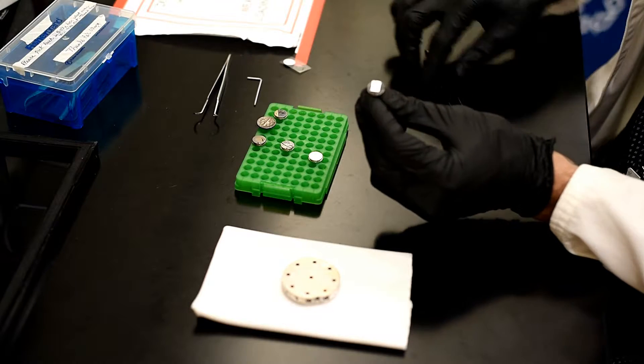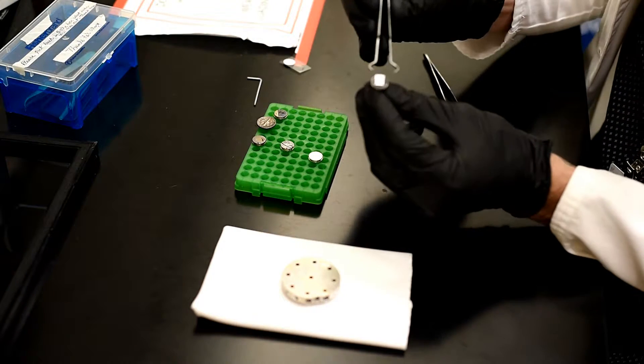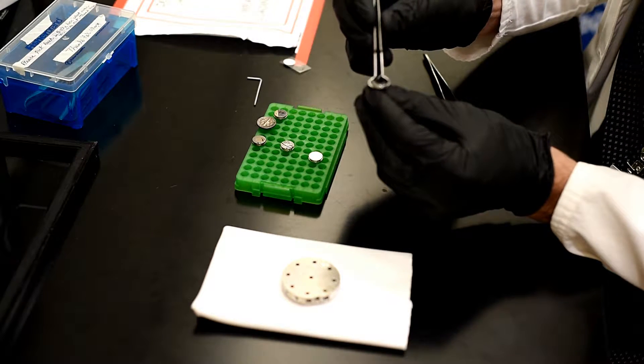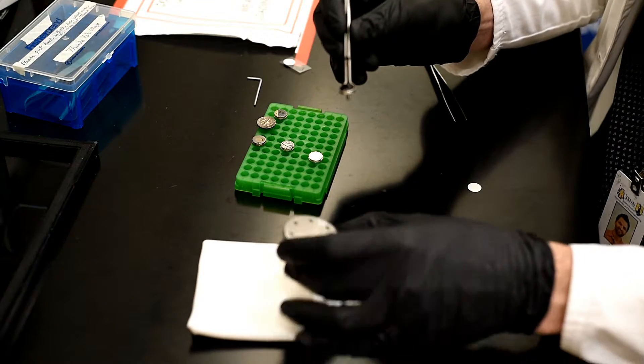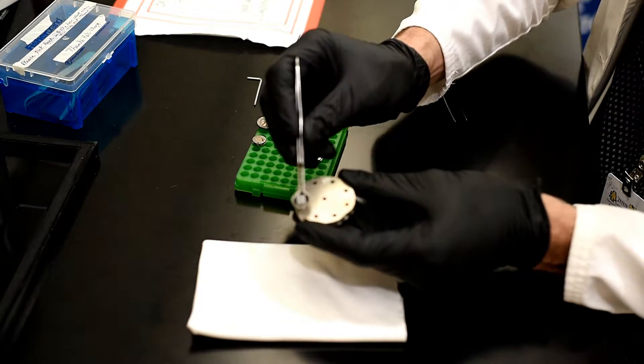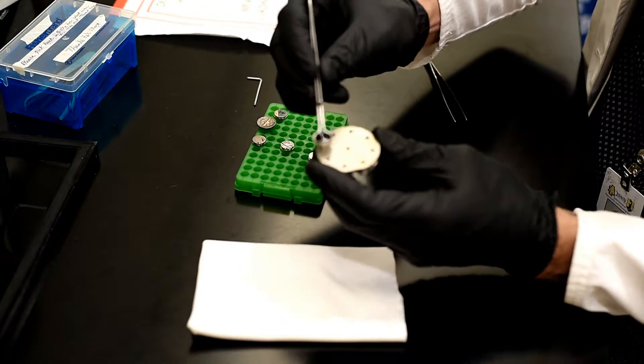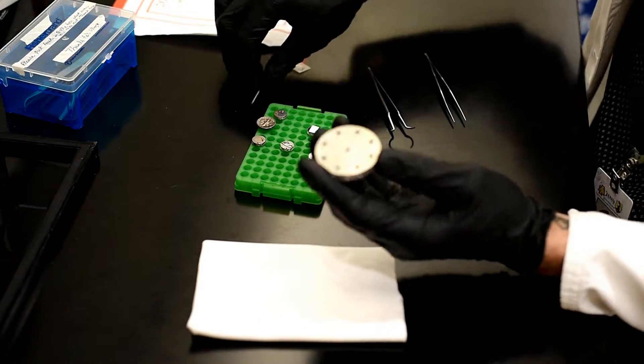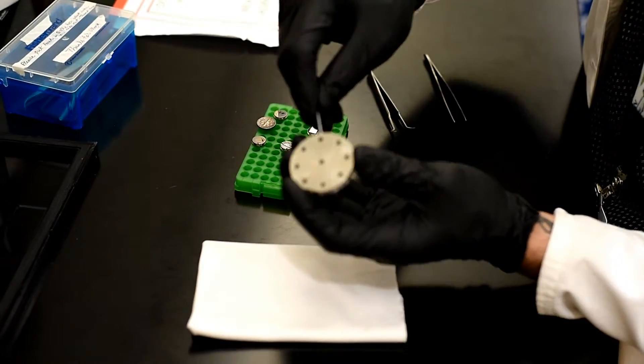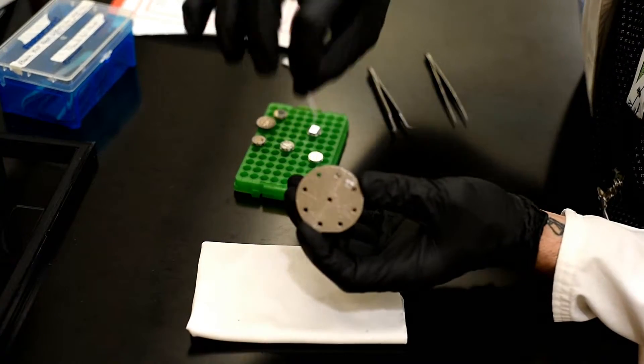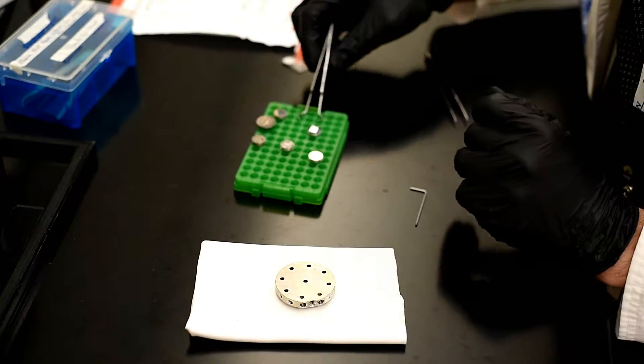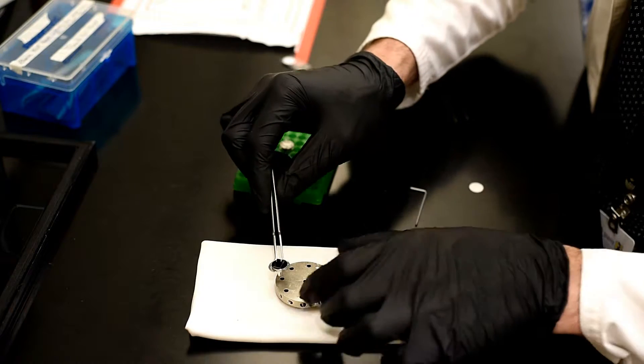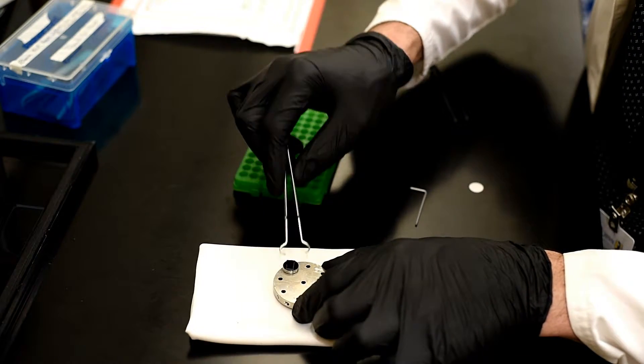So at this point, I could load this sample into one of the nine positions in the sample holder. And to do so, you see it's not fitting. So there is an Allen screw on the side that we can loosen. And now it should accommodate the stubs. You can load obviously up to nine at one time.